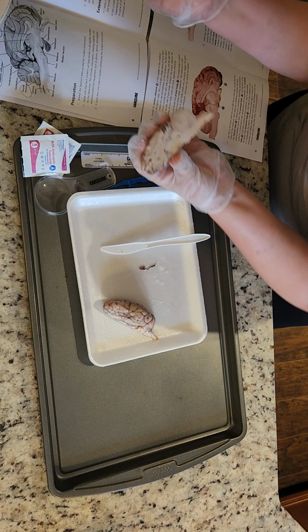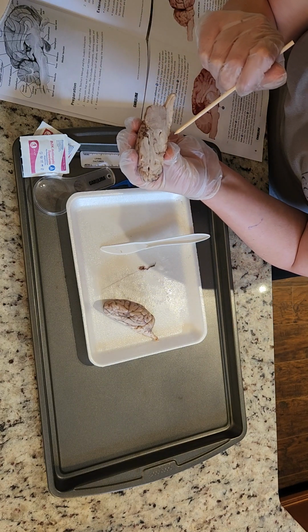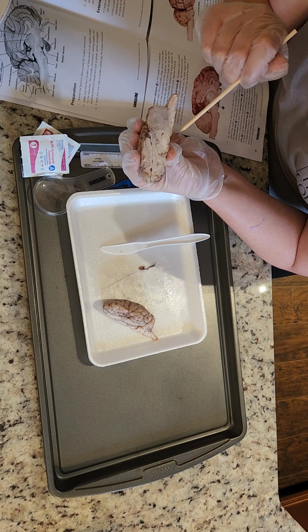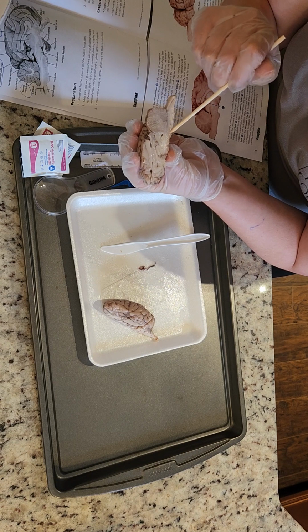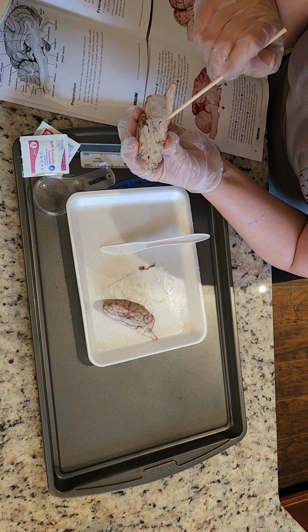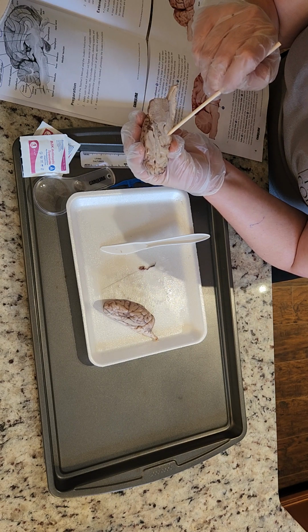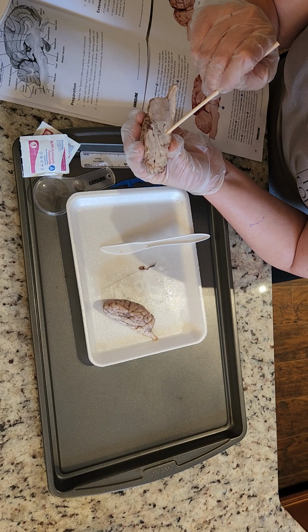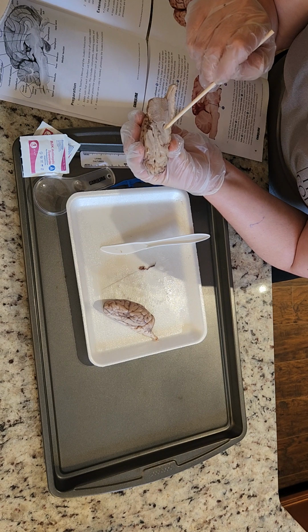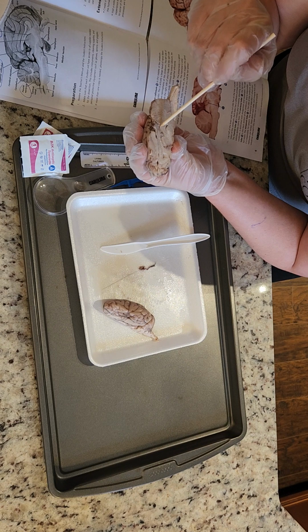Oops. Okay. I feel like this side of the brain is a little easier to see what's going on. Oh, it's because when I cut it, I kept the pineal body intact, which is what I'm using to locate where things are. This, I guess, is where the superior colliculus is.